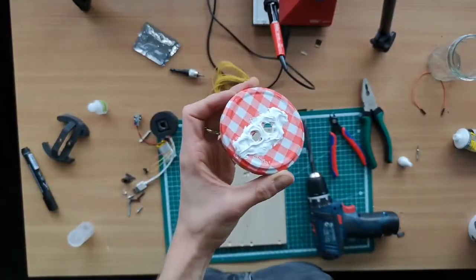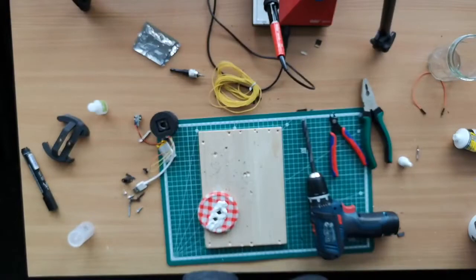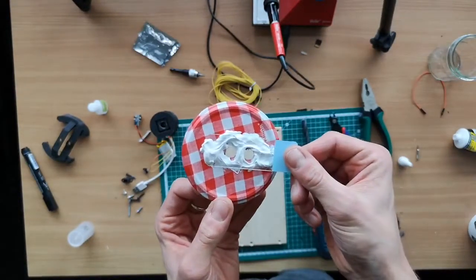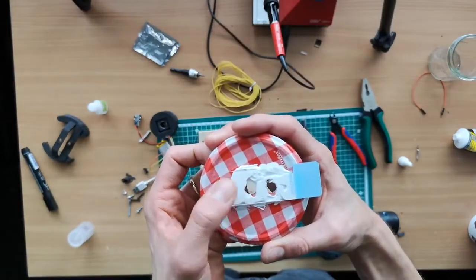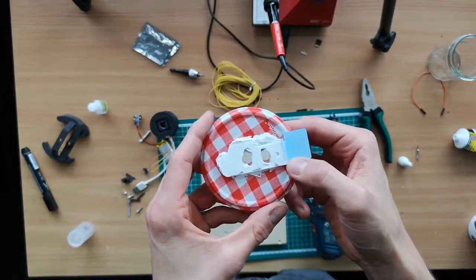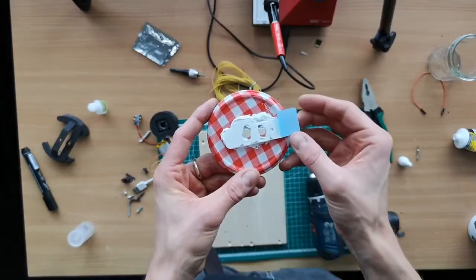So like that, roughly. And then you can add your cover glass. Clean it well before, use a cotton tip, and then just place it, be brave, and make sure that you're not squeezing any of the material into the hole, because then you cannot get rid of it anymore. Roughly like that. So then you have a hole here for the camera, and this is for the LED illumination.